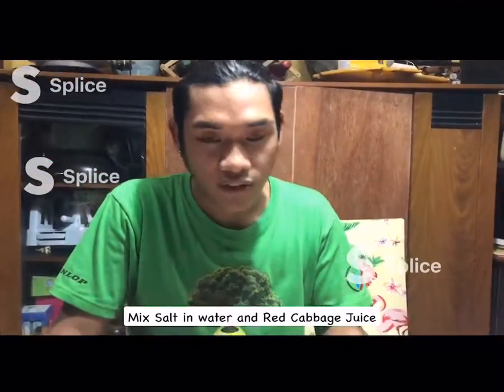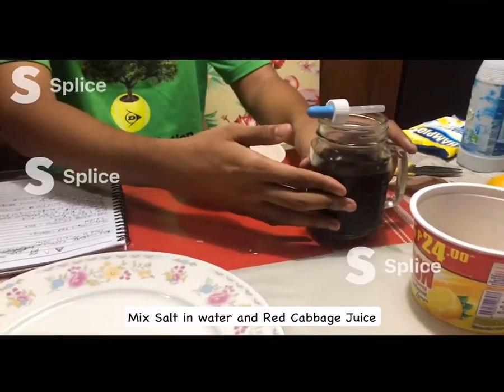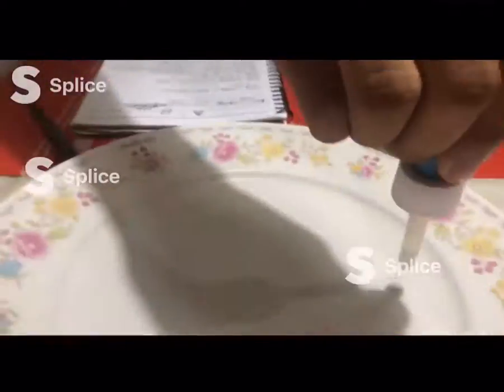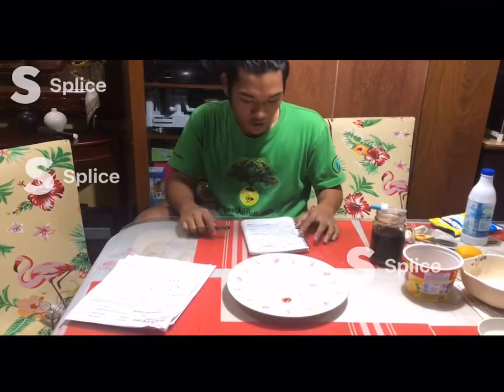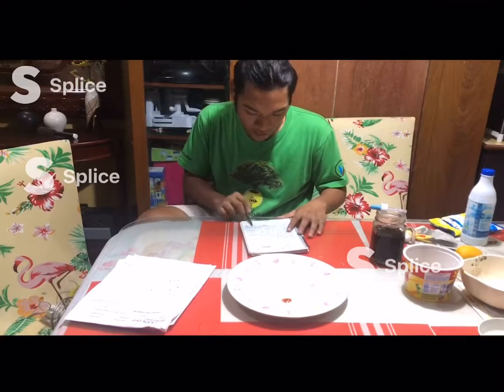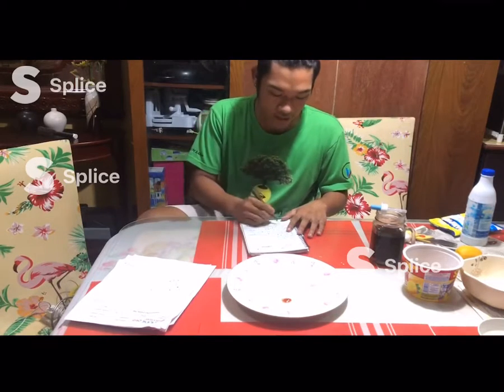So now, I will mix salt in water and the red cabbage juice. When I mix the salt water and the red cabbage juice, initially, no reaction happened. And after a few seconds, it changed to violet.